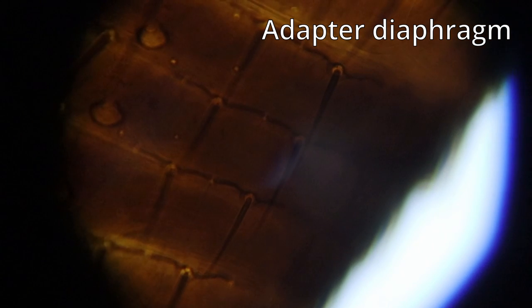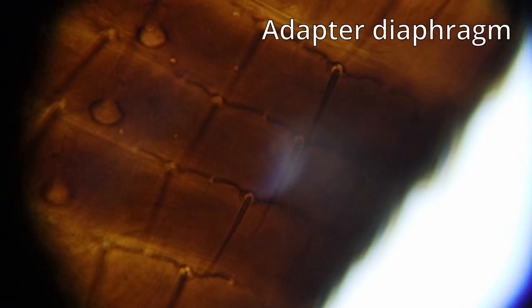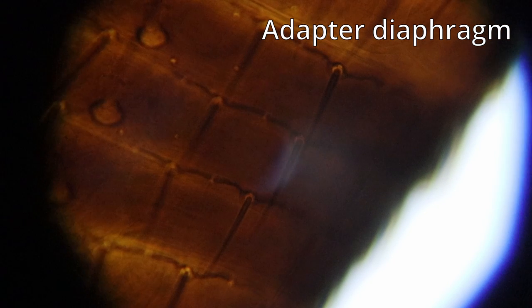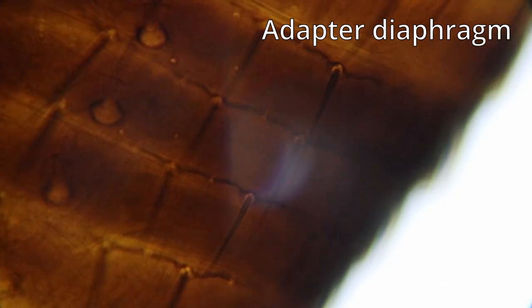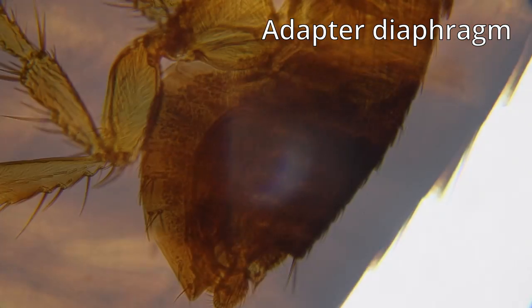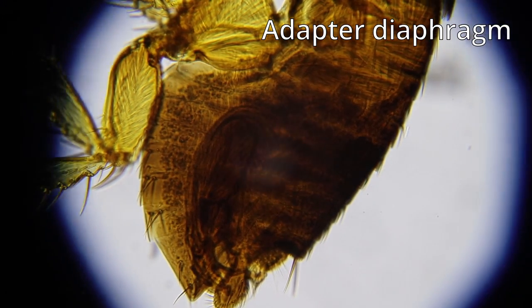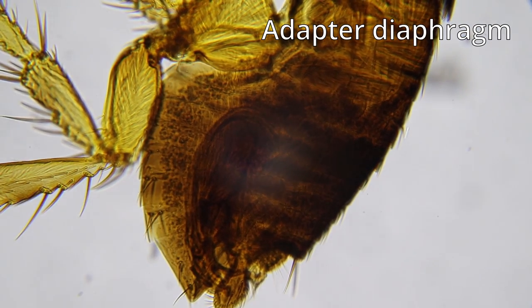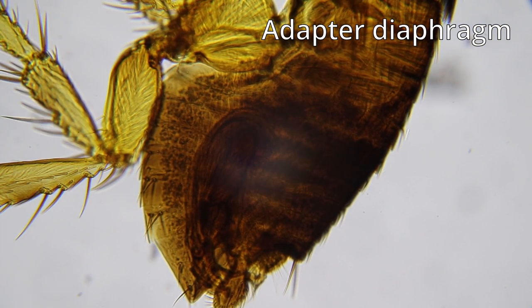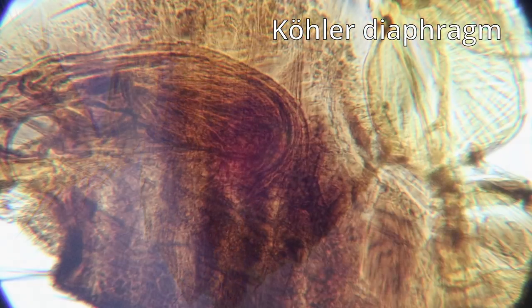So what's the whole point of this diaphragm then? To reduce the field of view? Why would it do that? And in this setting, when I opened it all the way, it was just able to capture the full field of view, so I couldn't even open it more. So this is a really strange thing. Here at a slightly lower magnification as well, look, there's this white part in the center. Now, I know that maybe this is not such a huge deal because when you do post-processing in a video editor, you might be able to remove that.